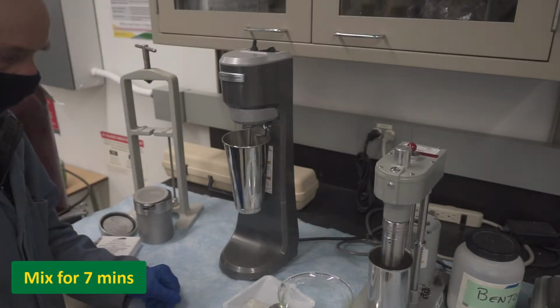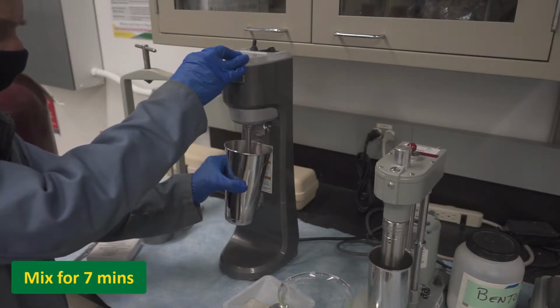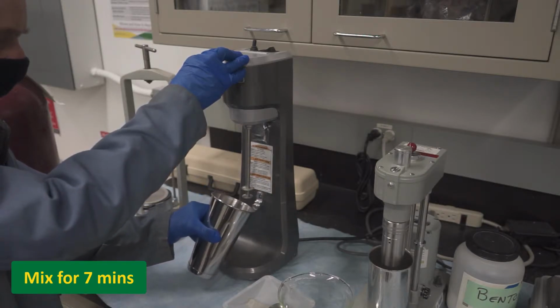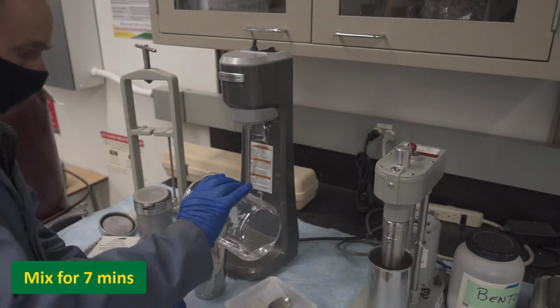Please recall the safety procedures for using the mud mixer. Specifically, do not wear anything that may be caught in the mud cup while the device is spinning, and also remember to add the water and bentonite slowly and in parts.